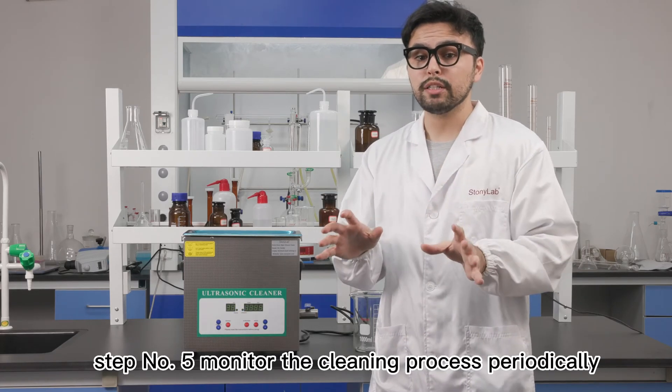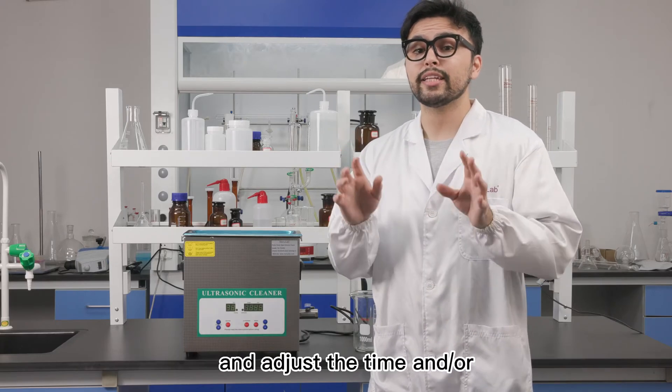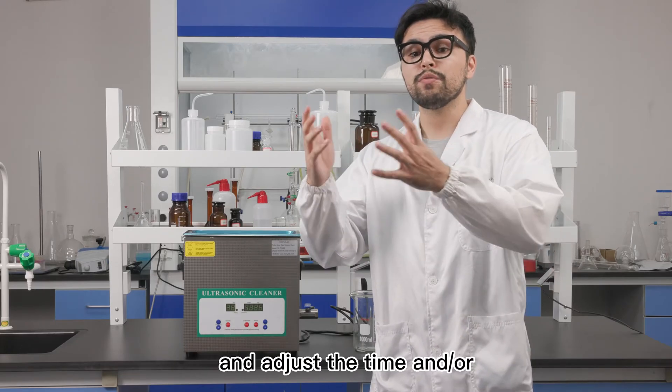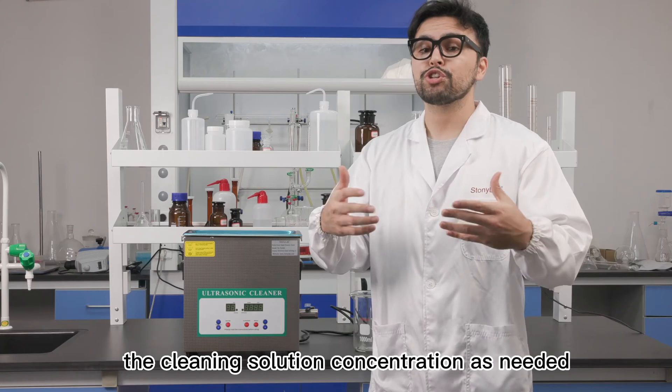Step number five, monitor the cleaning process periodically and adjust the time and or the cleaning solution concentration as needed.